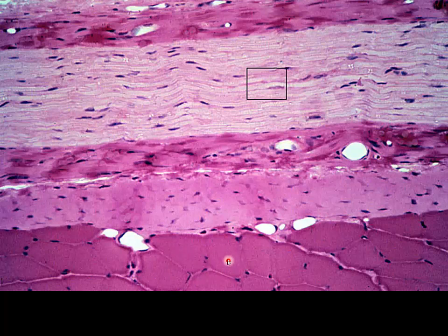Certainly you should be able to recognize this tissue by now. This is our skeletal muscle. And this is going to be our perineurium, and they will say epi as well, but really one fascicle. I'm just going to call this peri. But as this waves and you see this lighter color to this, and these nuclei are somewhat elongated in nature, they're kind of fatter than what we'd expect to see for fibroblasts. It gives you the indication that something else is going on.